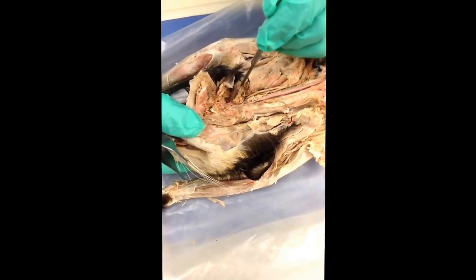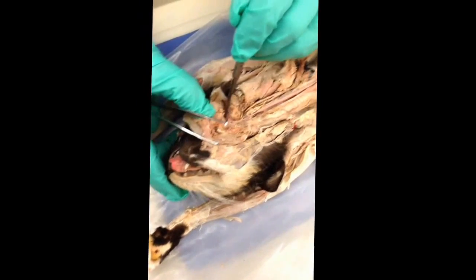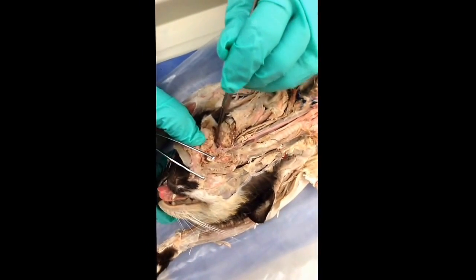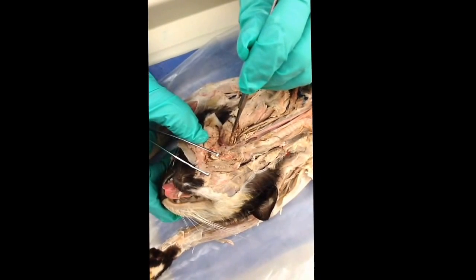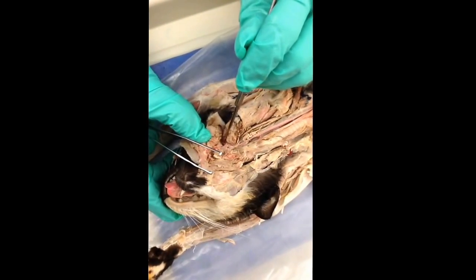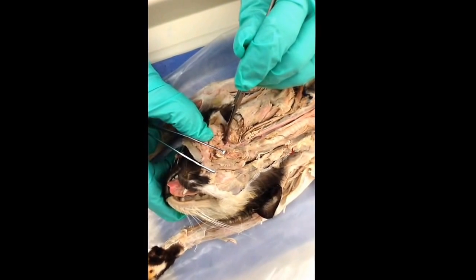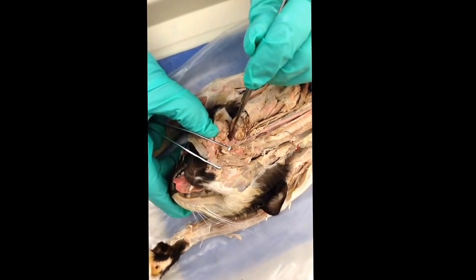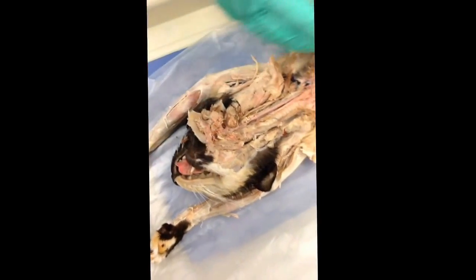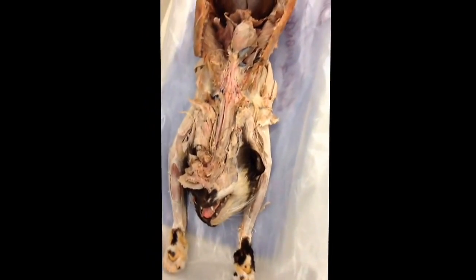And so that basically is what we ask. At one point down here, the extension of that external carotid, the extension right there was the posterior auricular. And so, again, I many times don't ask the bigger one down there. So that covers up here on the cat pretty well. Now, on your cat, let me see, you might have to cut it off.